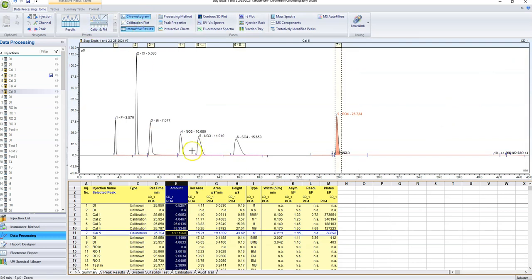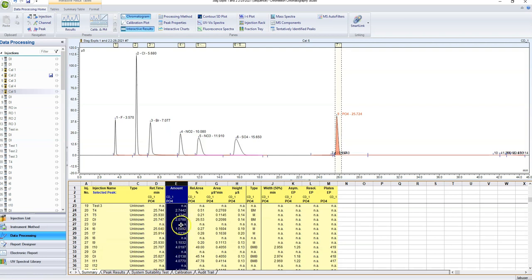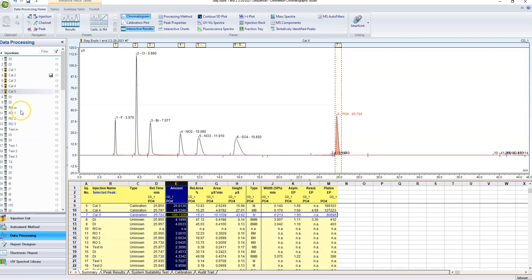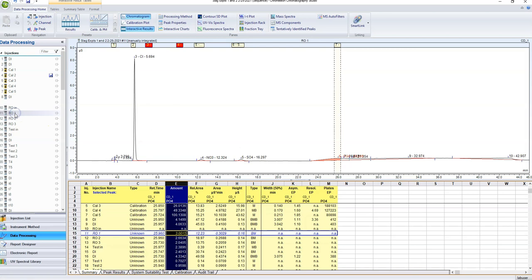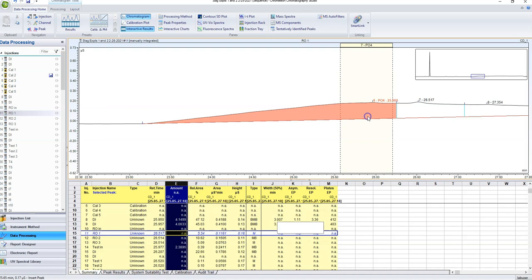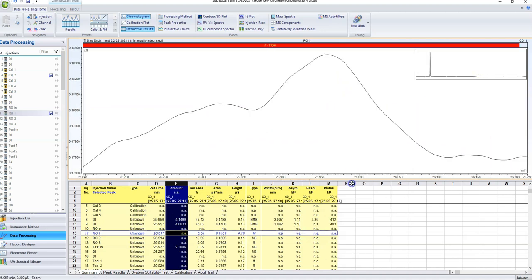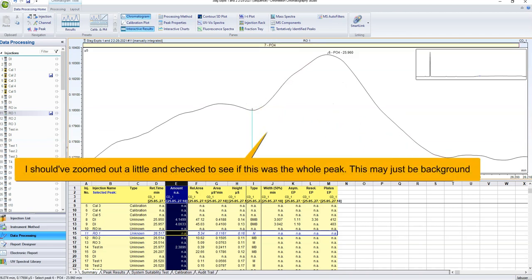So I don't actually need that open anymore. And we can see that these are the concentrations of phosphate in all of my samples. Now, I should technically go through each one of these and make sure that phosphate was selected. This is obviously not a peak. It just thinks that it is because there's nothing else here. So I want to delete that peak because there's nothing there, right? If I auto scale this, maybe there's something. There's a little bit of phosphate there.